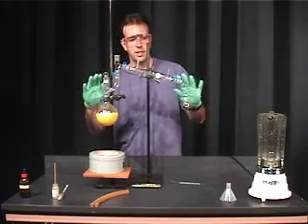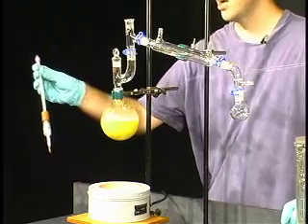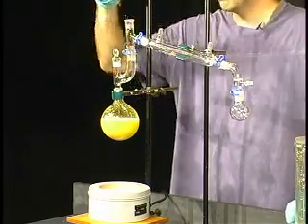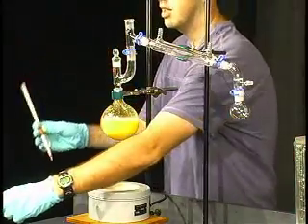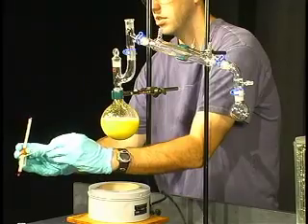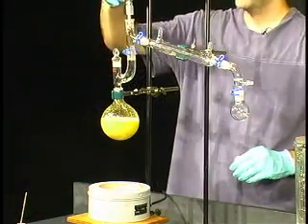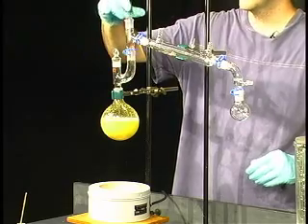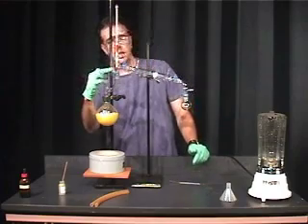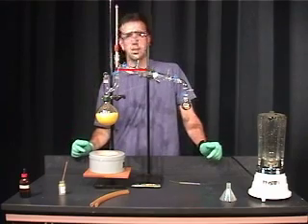Now that we've completed the glassware assembly, we want to add our thermometer and thermometer adapter. I've already connected the two — make sure we grease this, as it's going to come in contact with vapor as well. Add this in there and spin it around. The red part of the thermometer bulb should line up with the joint of the side arm adapter.